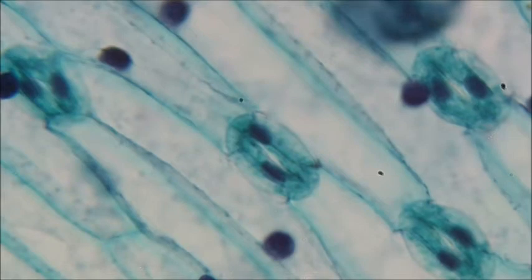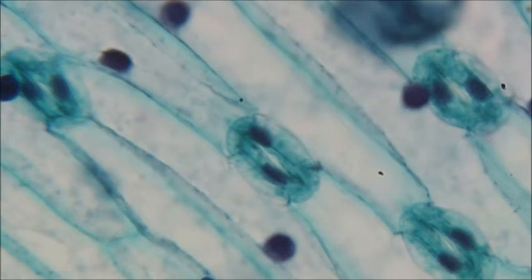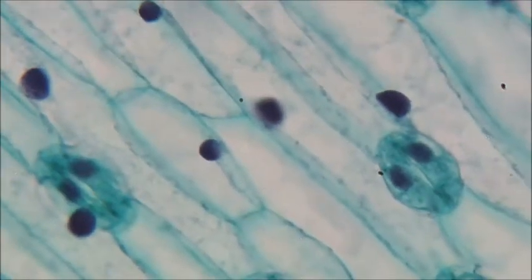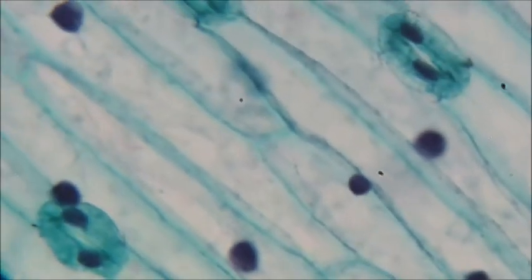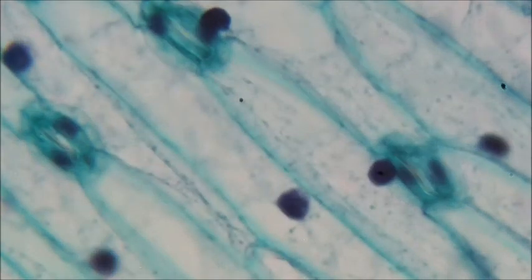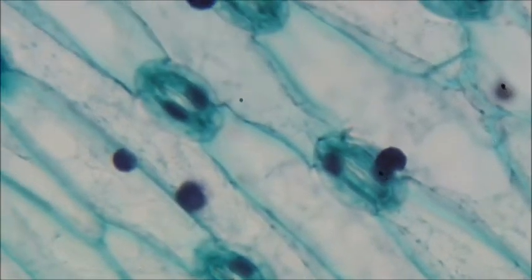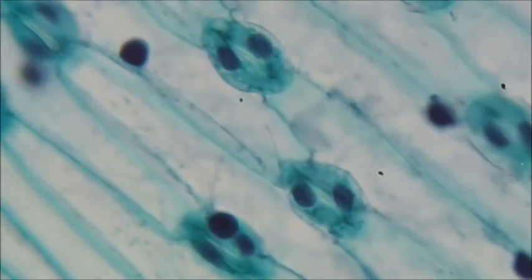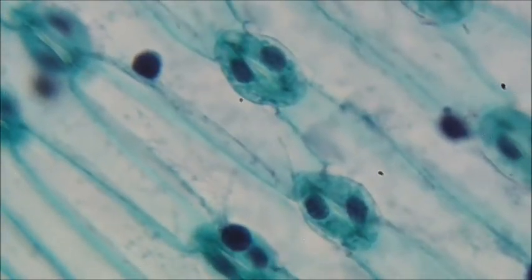Now the stomata is made of 2 cells that are kind of hugging each other, which is why you can see 2 nucleuses and the 2 cells forming that little circle. But all the other cells are the long kind of flat ones that are packed together. All these long cells look very much like onion cells as well. And a lot of plant cells have this look to them, this long, skinny, organized, tightly packed. So there's some more nucleuses that you can make out. Again, we really can't see other organelles, but that's normal with a light microscope.